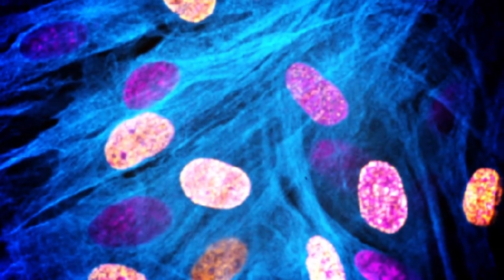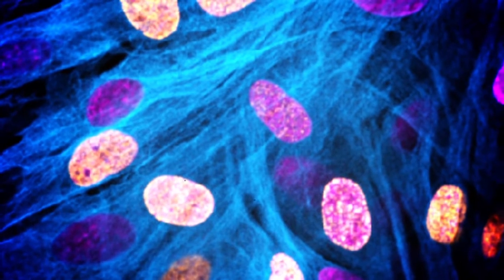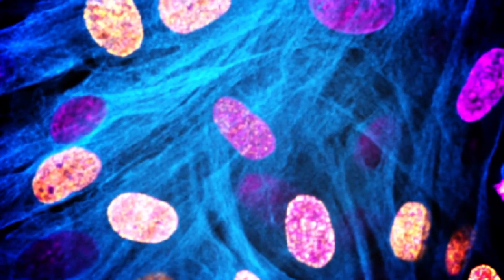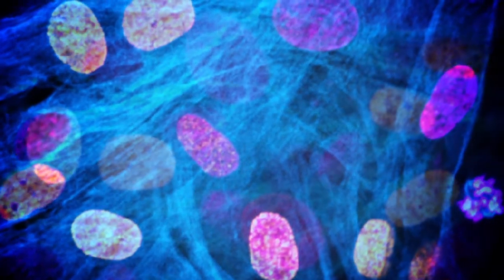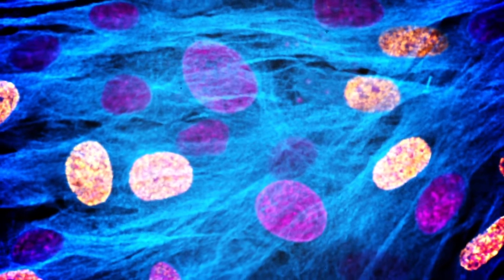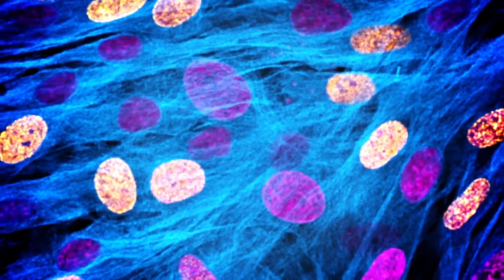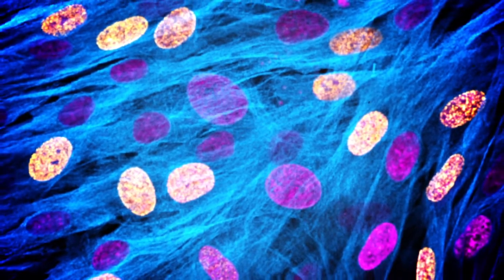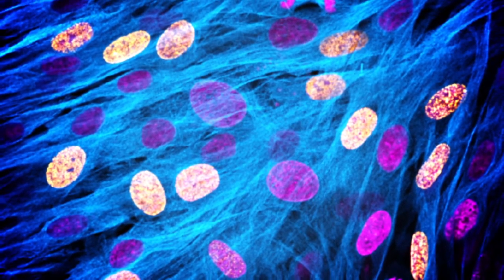Measuring DNA synthesis is the most precise way to detect changes in cell proliferation. Image-based proliferation assays, as demonstrated in this image where the proliferation signal is localized to the nucleus, generate spatial and temporal results that cannot be detected with other methods. This video describes and compares two of the most referenced image-based proliferation technologies.